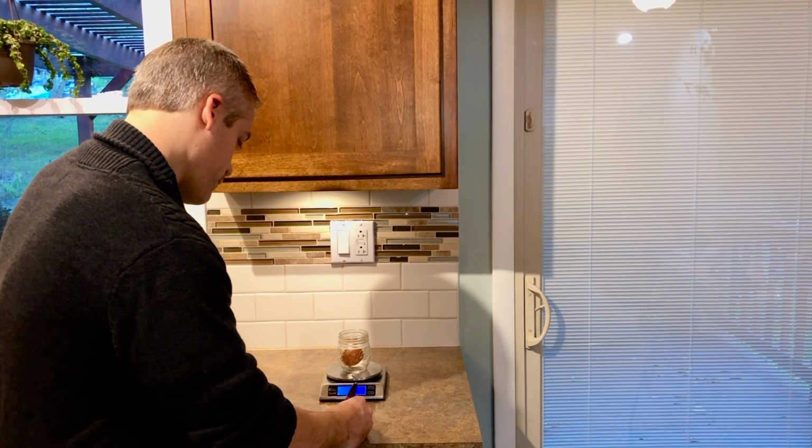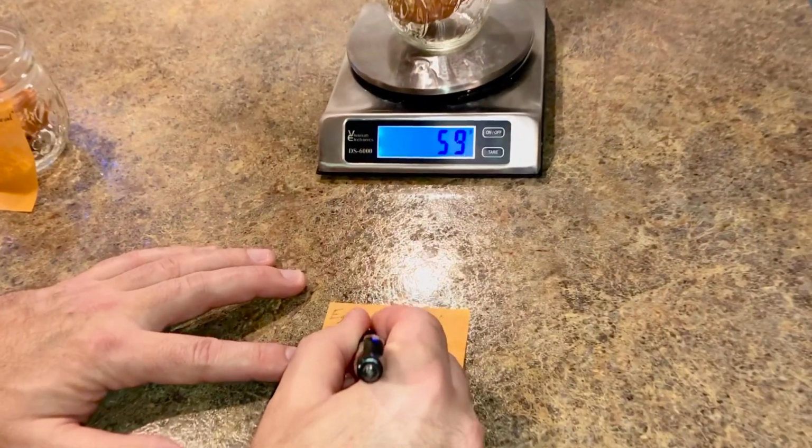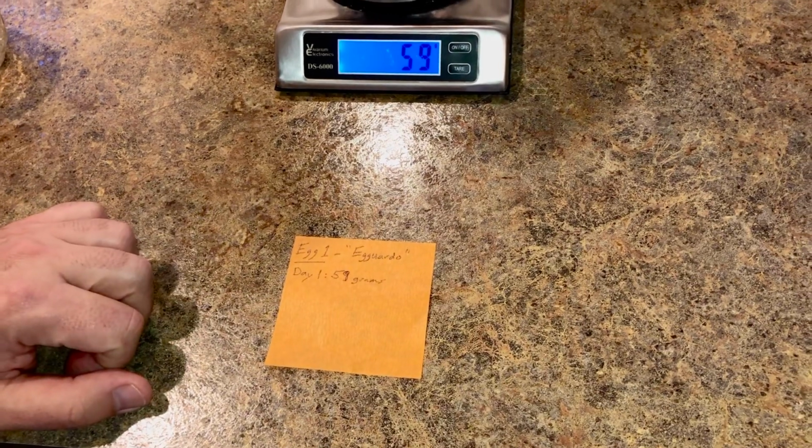Day 1, check this out. Day 1, 59, oops, I can't write very well, 59 grams, okay?